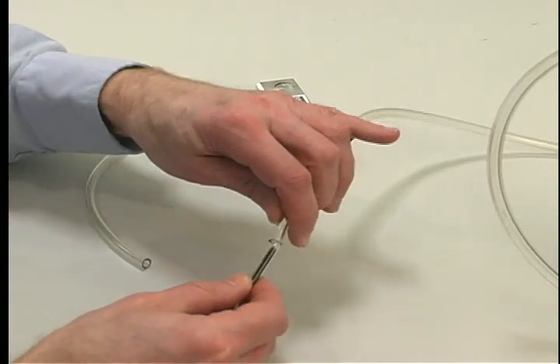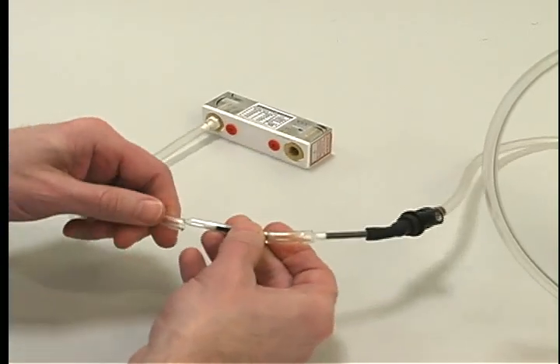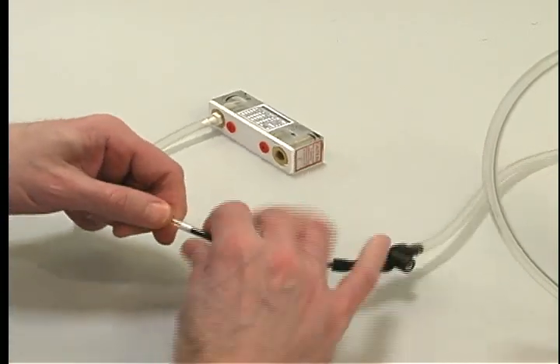Using a short length of tubing, connect the back sorbent tube to the front tube so that both tubes are oriented in the same direction, with arrows pointed toward the pump.